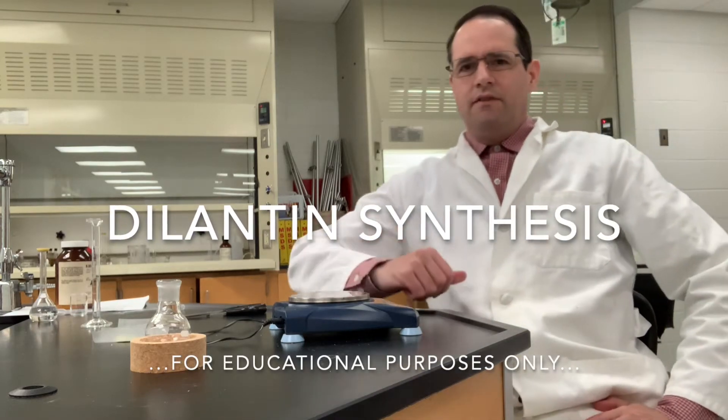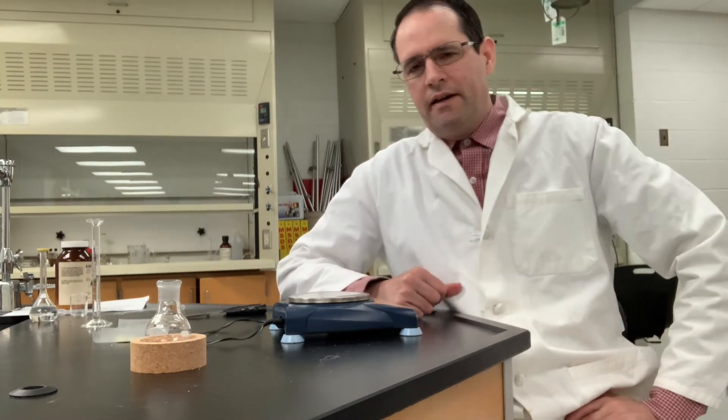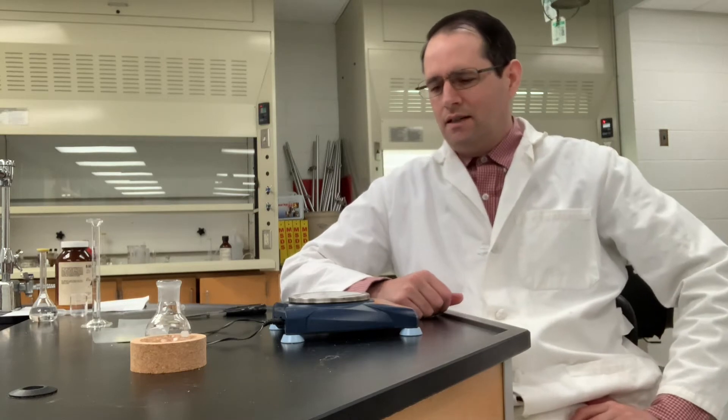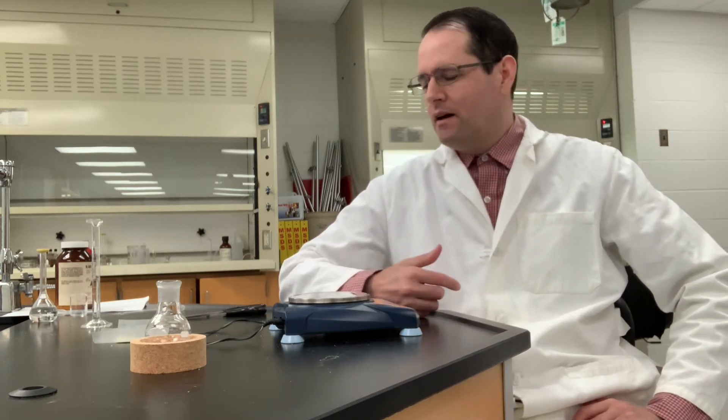In this video I'm going to make a drug in the lab called dilantin. It's used for anti-seizure medication. It's nothing too elaborate or exciting, but the chemistry is rather interesting because it involves a number of different carbonyl condensation reactions followed by a rearrangement.